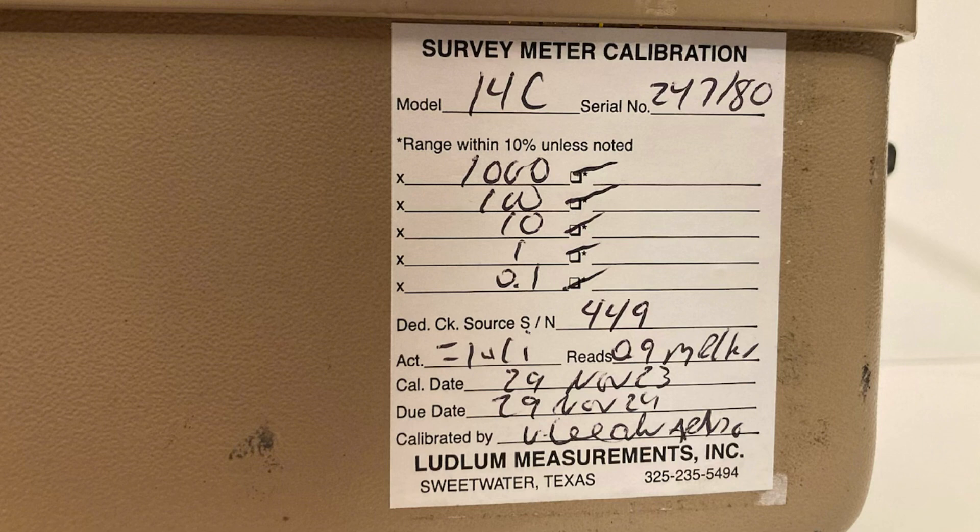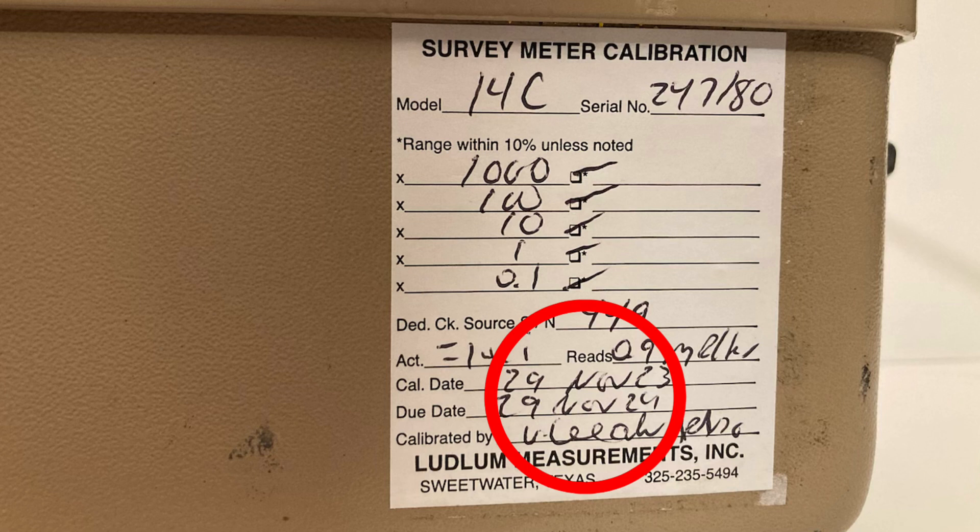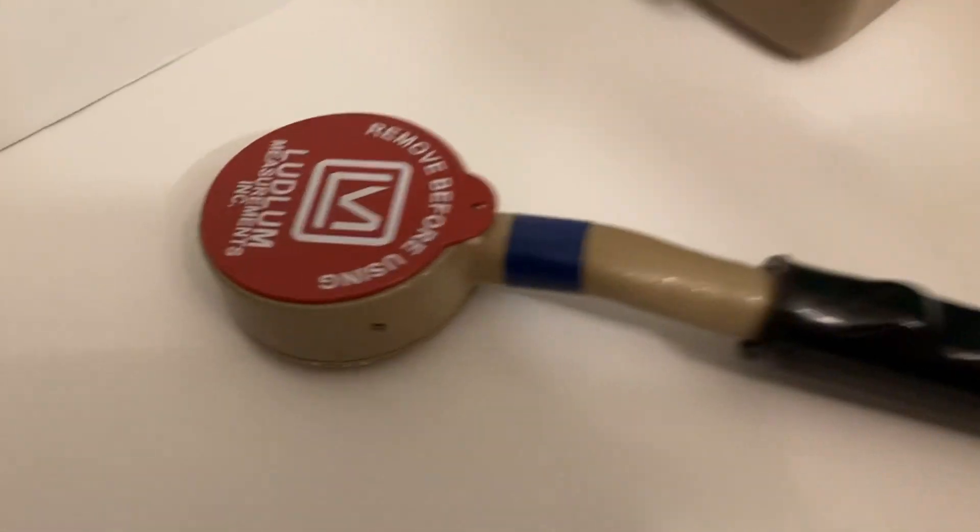While you're looking at the calibration sticker, also make sure that it is within the calibration date. If it is past the due date, the instrument may need calibrated. If it does, notify your boss.